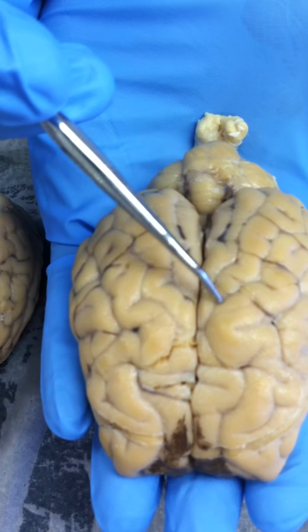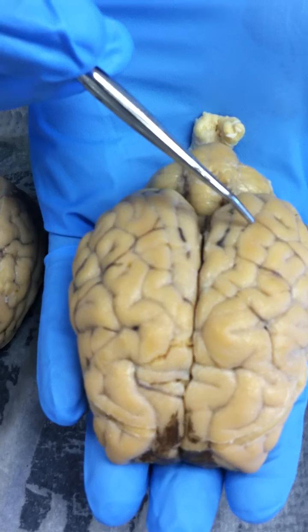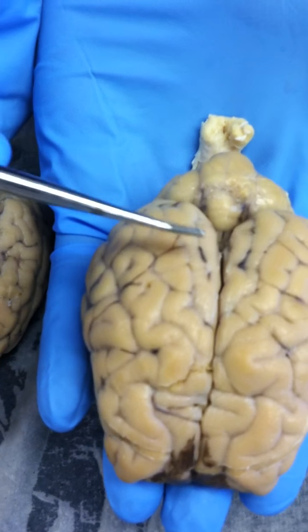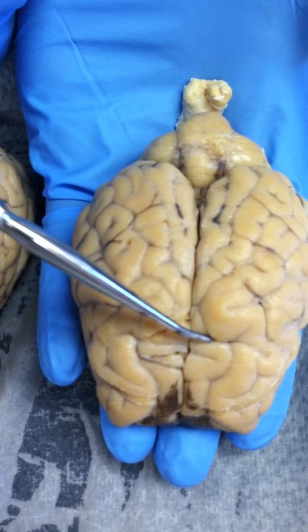And then sulci are the little lines in all of them, right? Then we have the central sulcus. You see the indentation, how it indents? Where it indents is the central sulcus. So just follow that across.